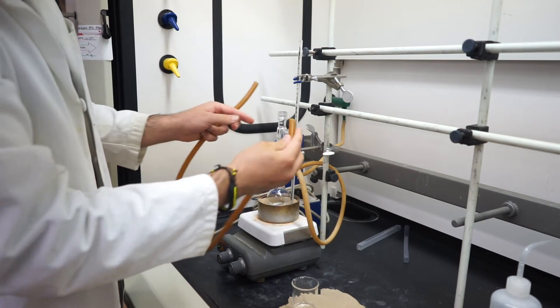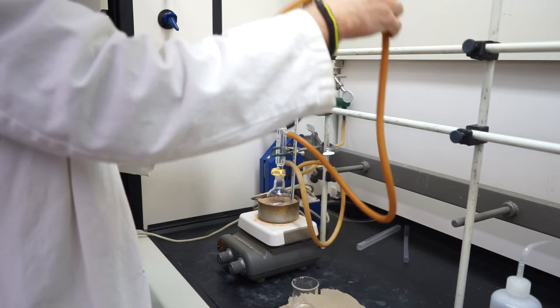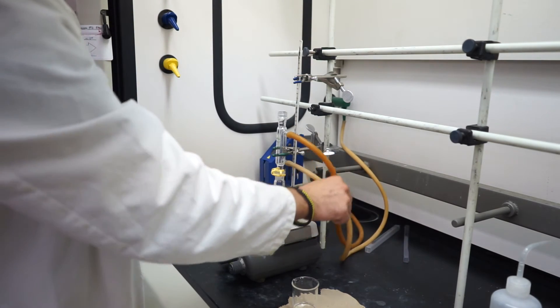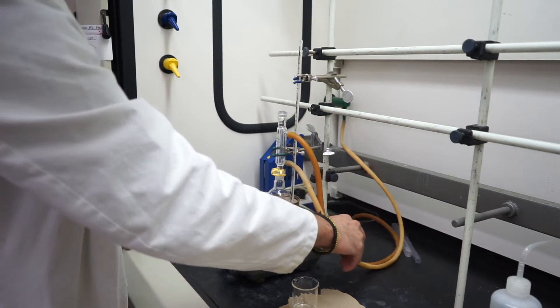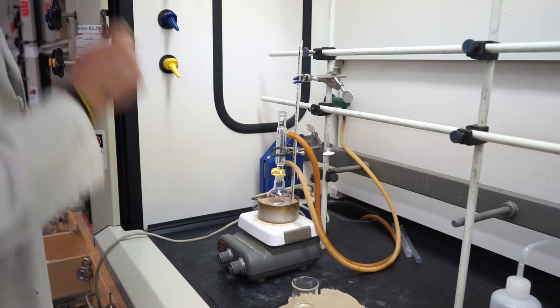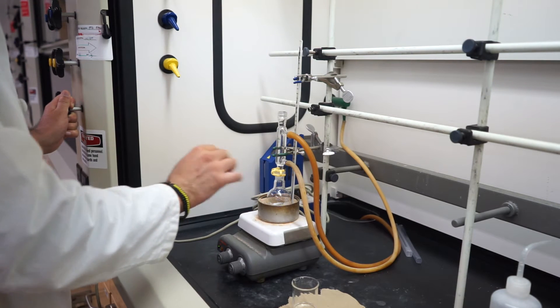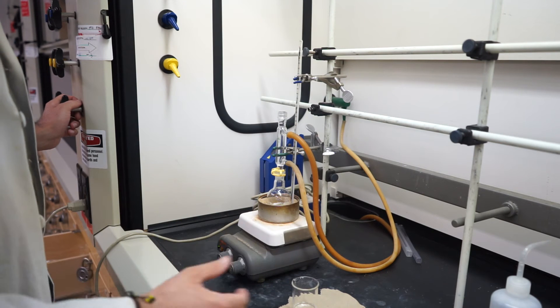We're going to grab our latex tubing, insert it through, and take the other set of latex tubing and make sure it is inside the drain in the back of your hood. We'll adjust these to make sure they're not touching the hot plate. Then, of course, we can turn our water on. The water is going to fill and we've got a nice stream of water, and we'll have it nice and slow to make sure we don't waste too much water — we are in a drought.